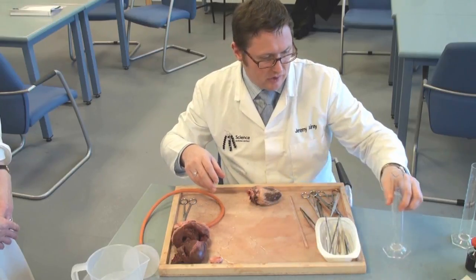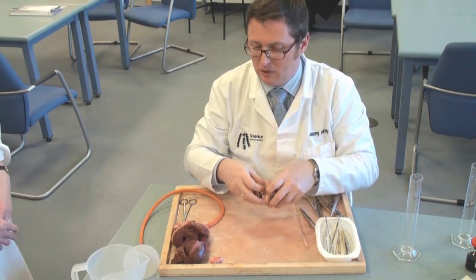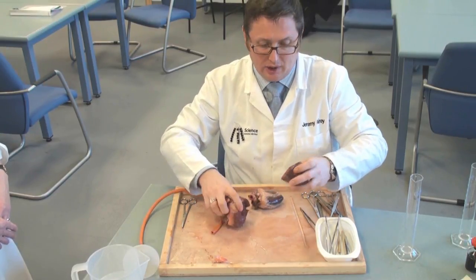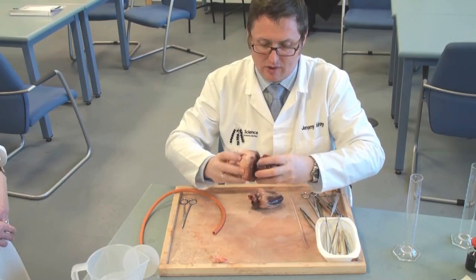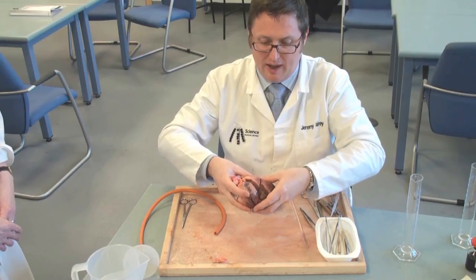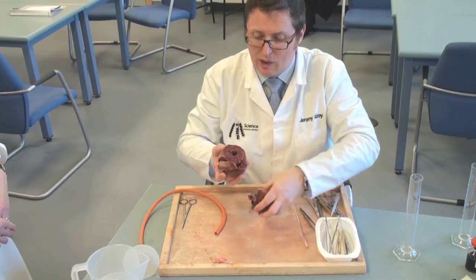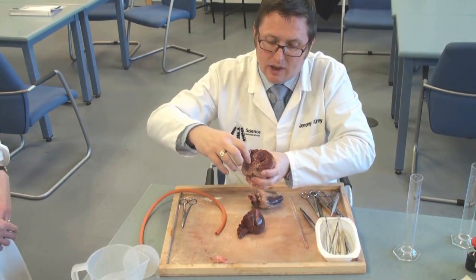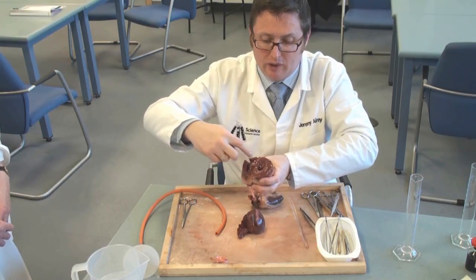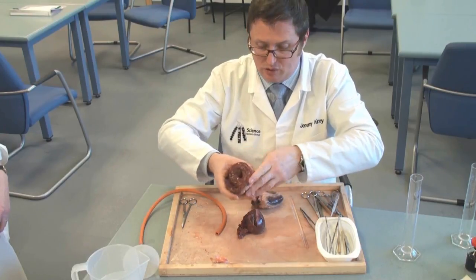One thing you can do in your dissections is a different kind of dissection rather than a full anatomical one. Here's another one I prepared earlier — this heart was really badly slashed by the vet, so I've literally cut it in half so you can see the two chambers. There's the right ventricle with a much thinner wall, and the left ventricle with a much thicker wall. That's a nice one to show students.